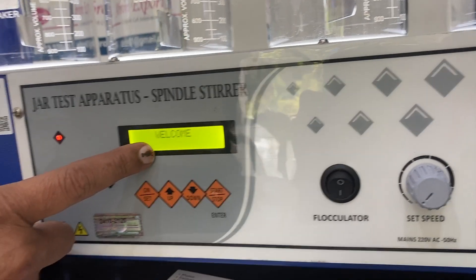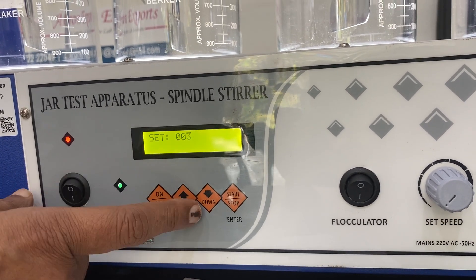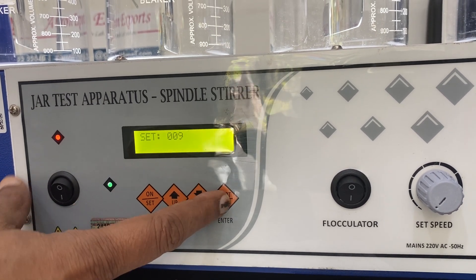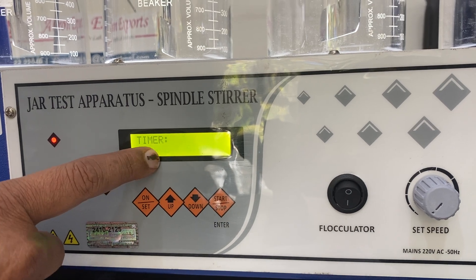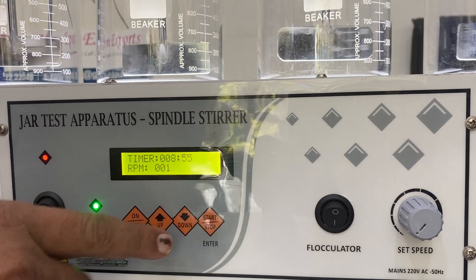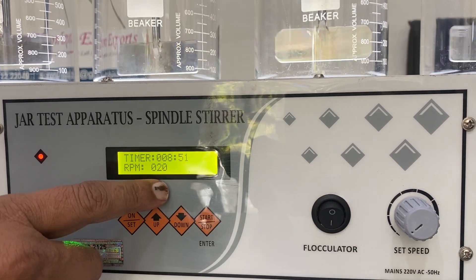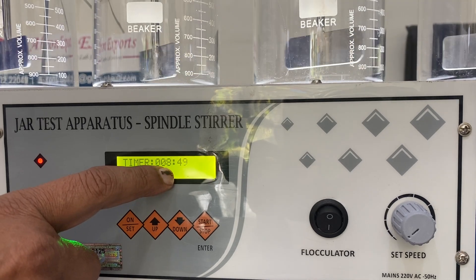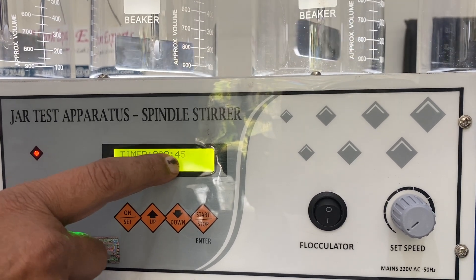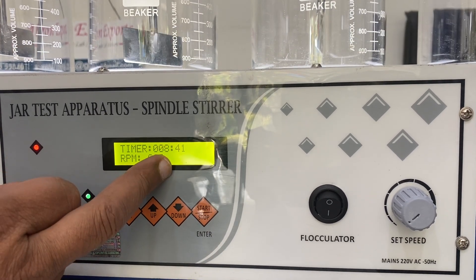After switching on it shows the welcome screen, and then the timer — I can increase it to three, four, five, six, seven, nine minutes — then push to save. Now the time is nine minutes with a speed of approximately 1.9 to 20 revolutions per minute. The time counts down and I can switch off at any moment.